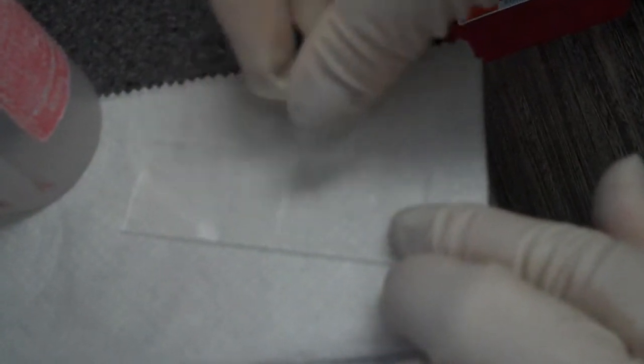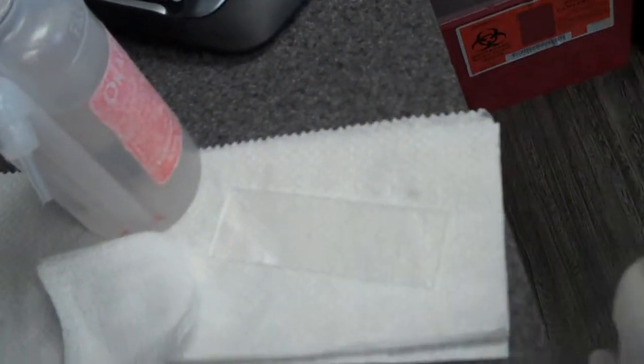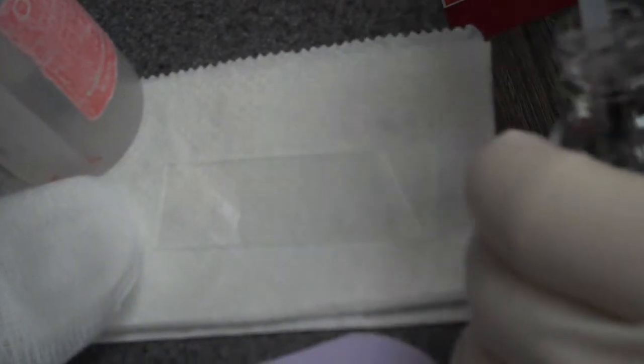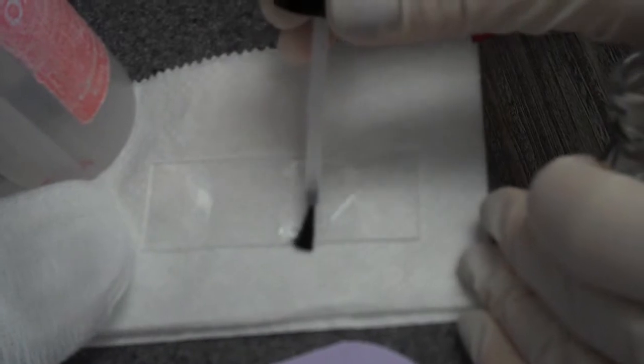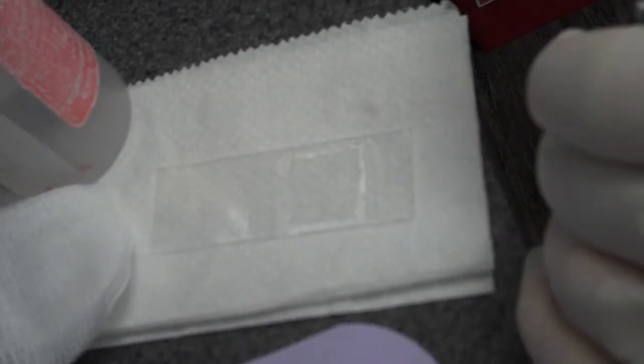What we're going to do is tease that off — that's three areas, a little bit of plaque, that'll be plenty. We take the little cover slip and just gently let it drop on there. Then I take one piece of gauze and just gently squish and dry up the fluid around the edges so that we can seal it up. If you don't seal it, oxygen gets underneath it and the sample's contaminated with oxygen — it'll kill the bacteria and dry it out. So you want to seal it up with the sealer. Keeps all the air out. And you've got a nice sample.